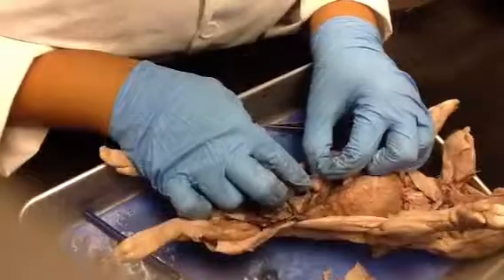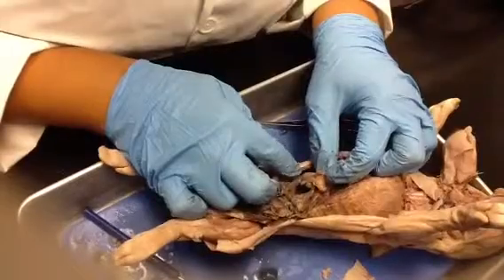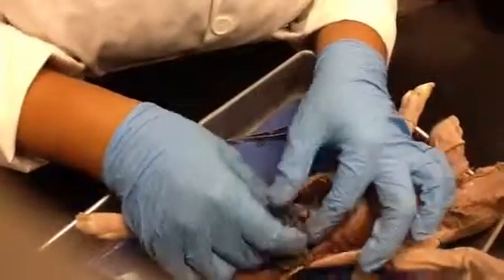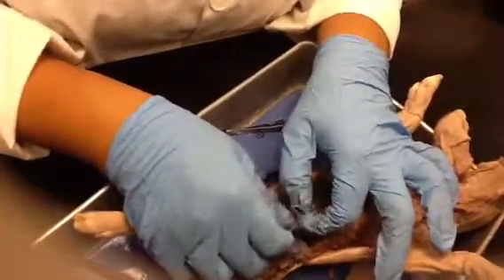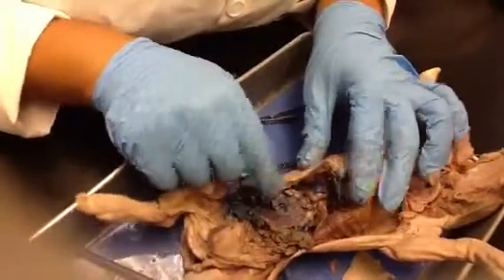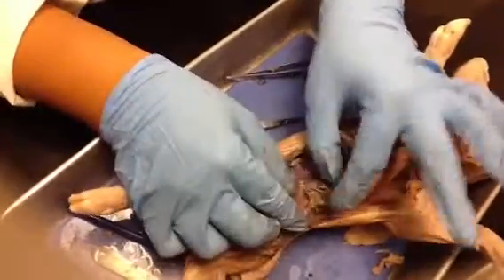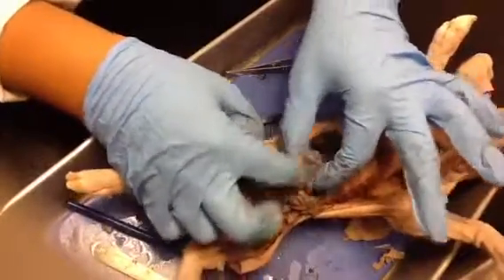Do you see that bubble right there? That is part of the pyloric sphincter. And then your pancreas back here. This continues. This here is your small intestine. I know that it has blue stuff on it, but forget the blue stuff. What I do want you to note is the mesentery. Do you see the mesentery? That's the pink lines. That's all mesentery. So all of this is small intestine, and it still has mesentery. Remember, mesentery is the connective tissue that basically keeps everything organized.